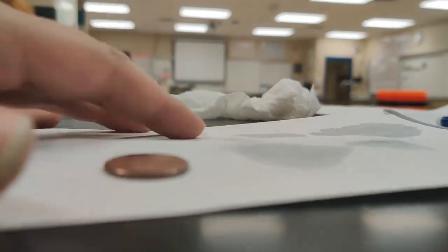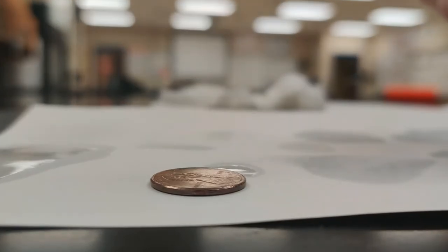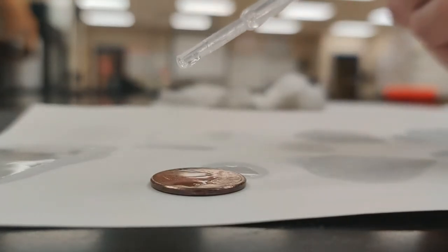Now let's grab a towel here and dry this off well so we can go on for trial 4. Trying to keep an eye both on the camera to make sure that it's staying in focus and on this.